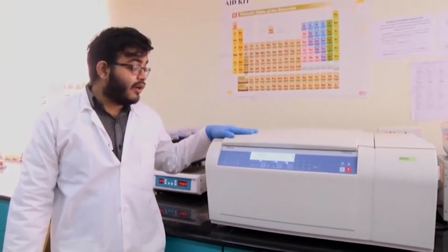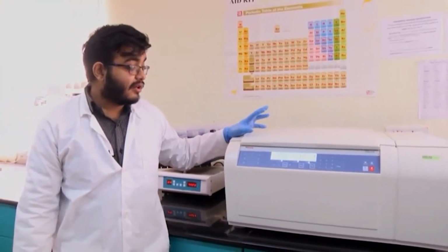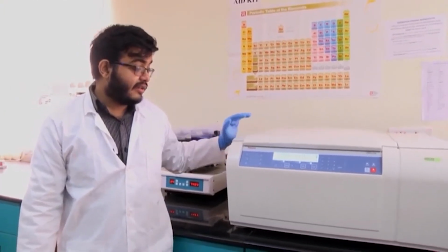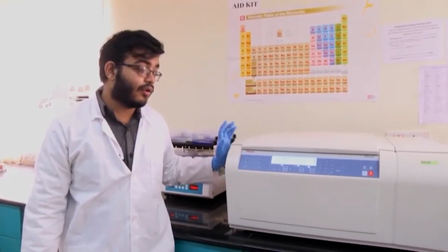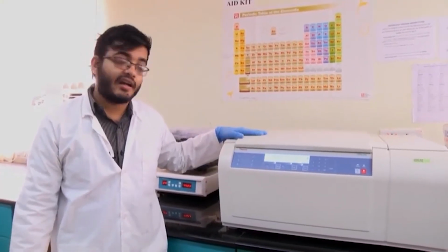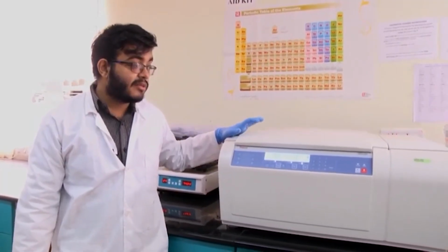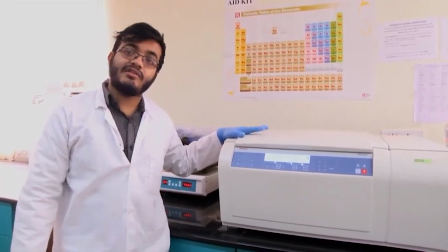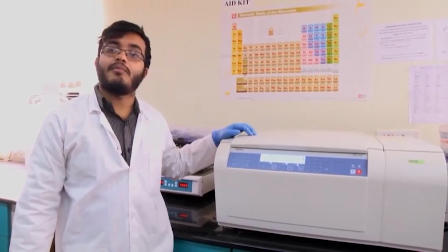What I have in front of me now is a centrifuge. It is a temperature controlled centrifuge, and its purpose is to centrifuge different samples. And this is a temperature controlled centrifuge, which means we can maintain it at 25 degrees centigrade or lower, maybe 4 degrees or 16 degrees, or even if required slightly higher. So, we can centrifuge solutions using such centrifuges, and you will be seeing in the subsequent lectures that centrifugation is a very essential process required for many different experimental purposes in the laboratory.